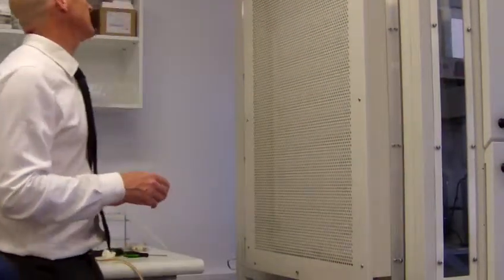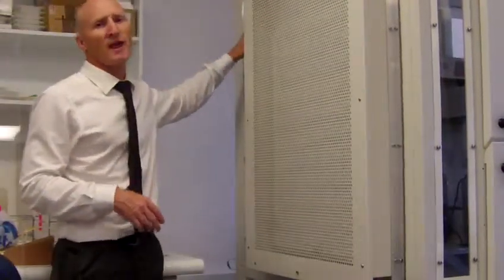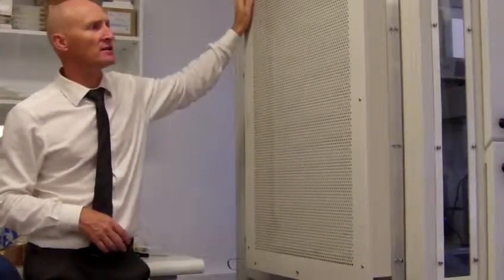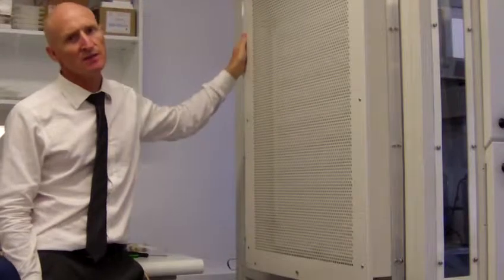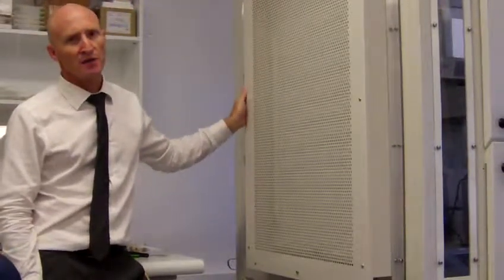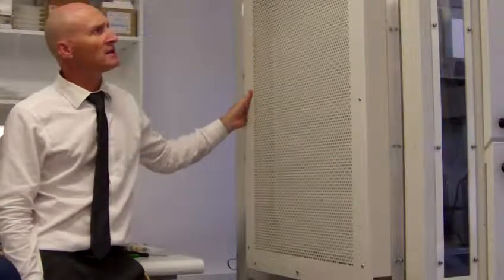Okay, the first thing that I did was to take out the plastic panel from the side here. And this was so that we could actually insert the exhaust HEPA filter inside this mounting. And this we got from an Australian supplier, SW Hart.